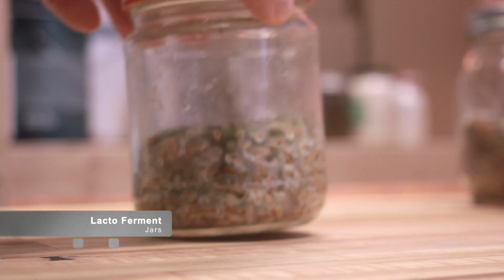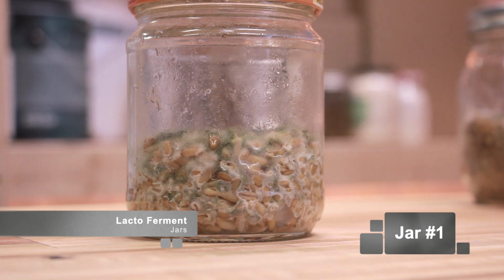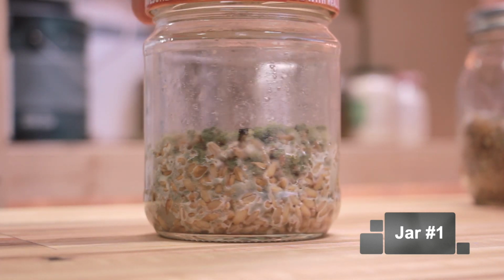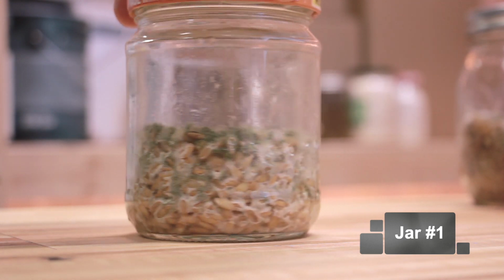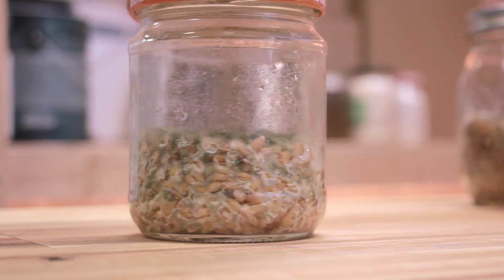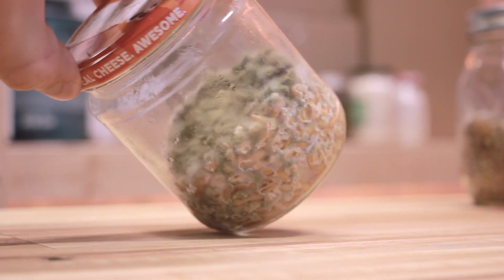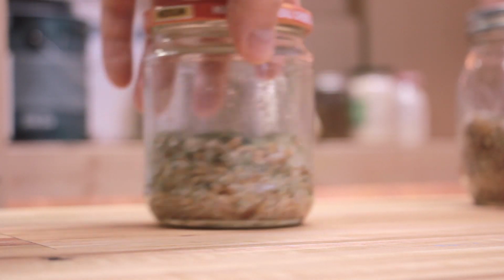But as you can see, it got colonized pretty rapidly with green mold, and then yellow mold and black mold is in there too. A little bit of the hyphae from the oyster started taking off, but it got quickly taken over by the competing molds.